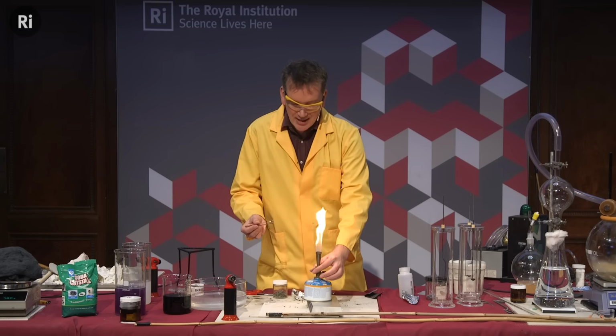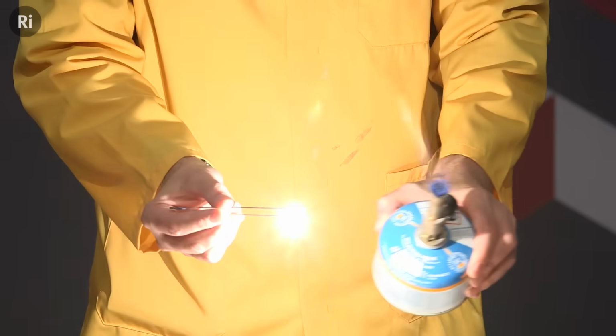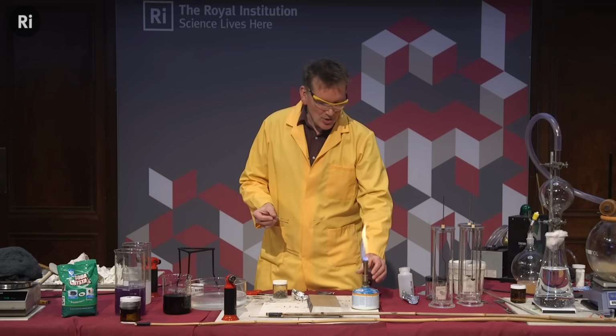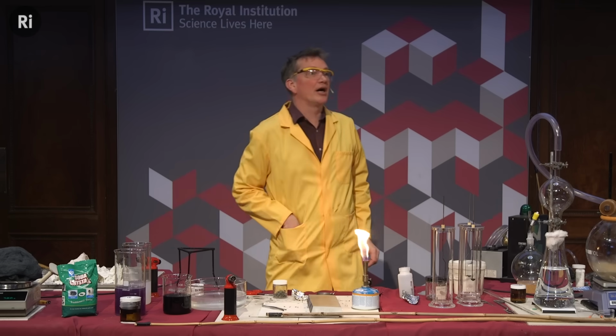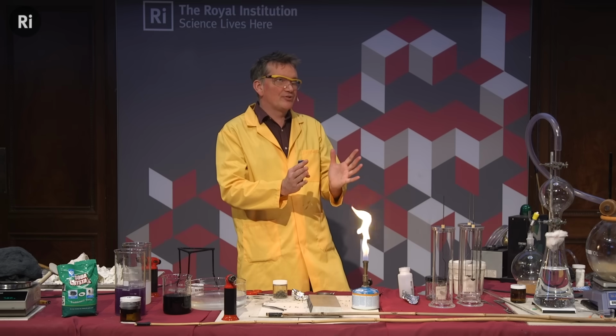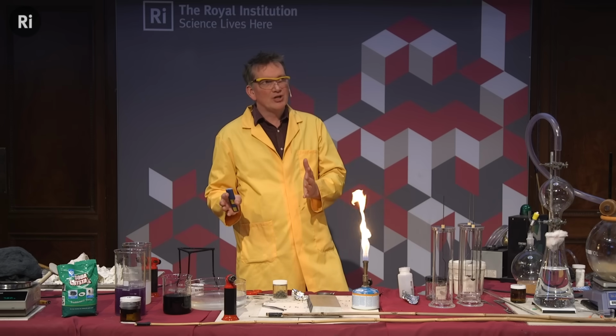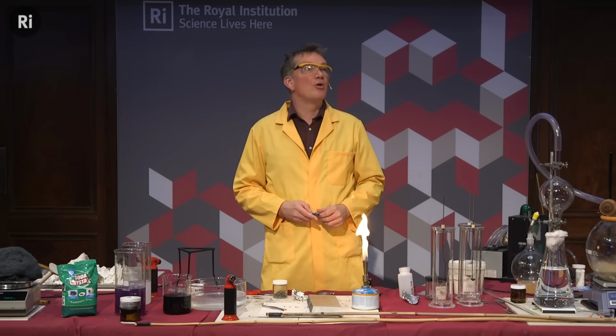And if I heat it up, it should burn with a brilliant white flame. Oh, that was quite exciting, wasn't it? With a brilliant white flame, forming scandium oxide. So a very violent reaction there, but indeed it is 2 atoms of scandium with 3 atoms of oxygen. Okay? Right, well, let's pick one of the elements from group 3.